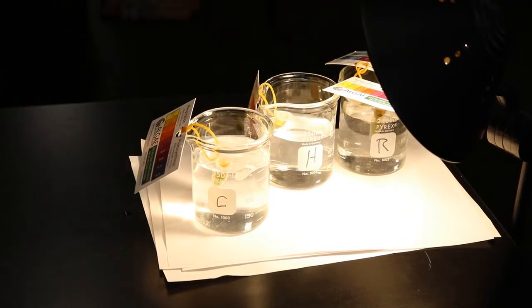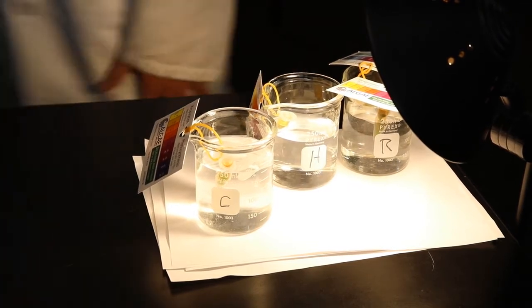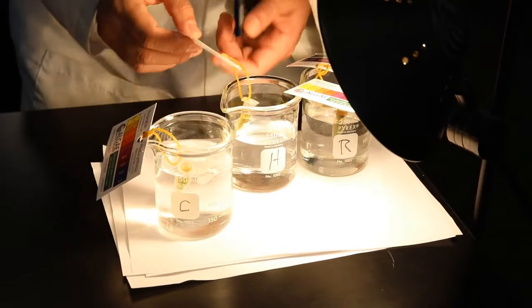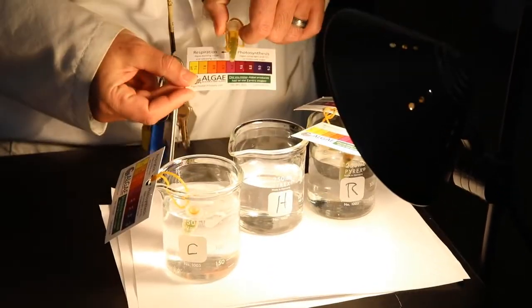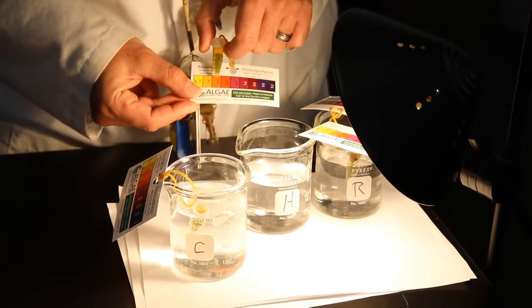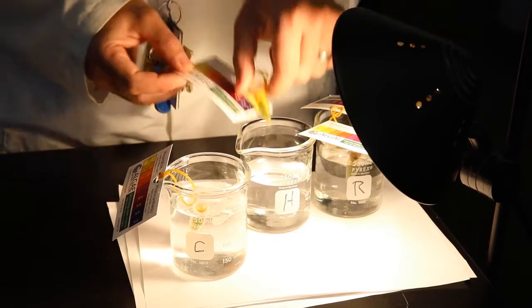So right here. Just put it right in the middle. Yeah, that works. Okay, number 2, our hot. If we look at that, not much change. I know on the first one we had 7.4, but I would go ahead and say 7.6 is the change there.